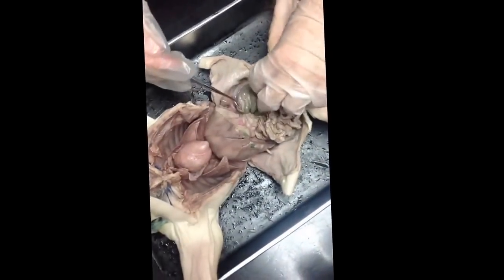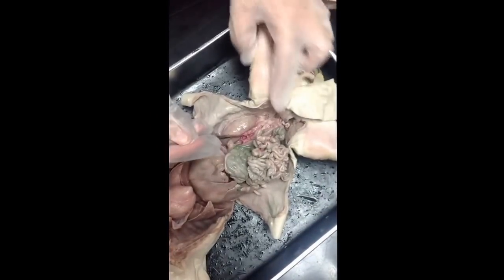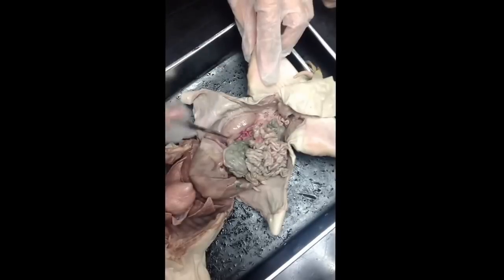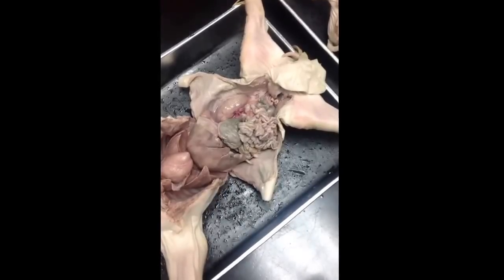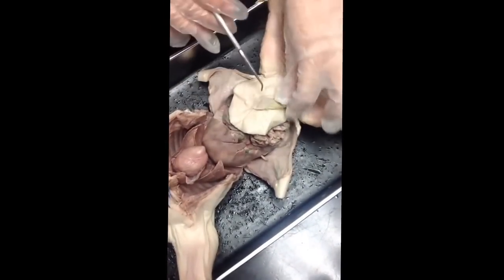Now, if I ask you for the blood vessels that are leading in and out of the kidneys, anything with the kidneys is renal. Now, we don't always have perfect coloration between red versus blue, so we'll just lump them together as your renal arteries and veins. Okay, for fetal circulation, it all starts at the umbilical cord.